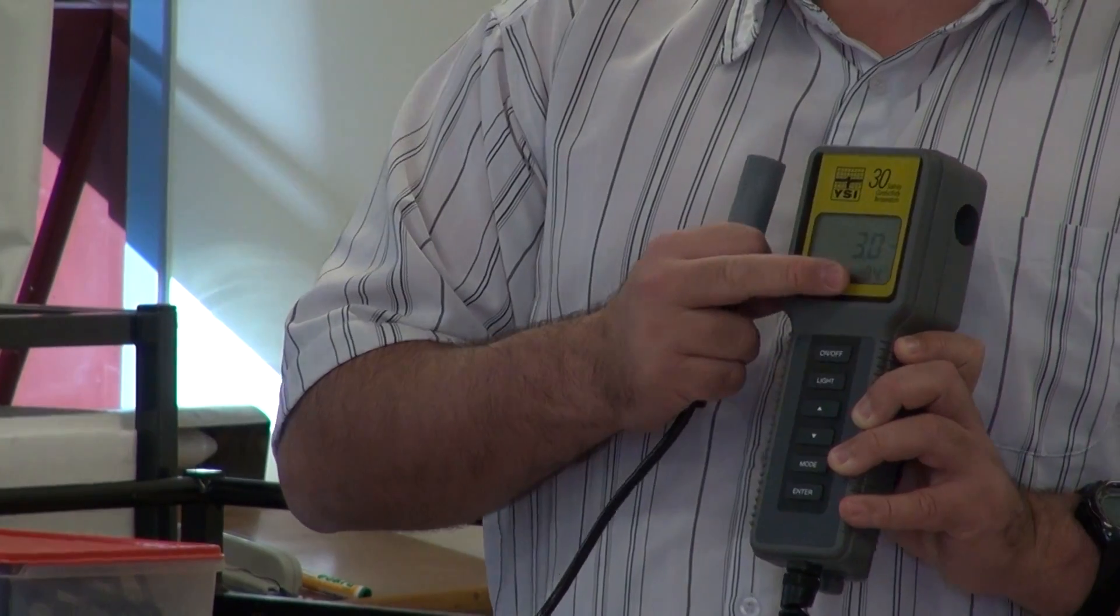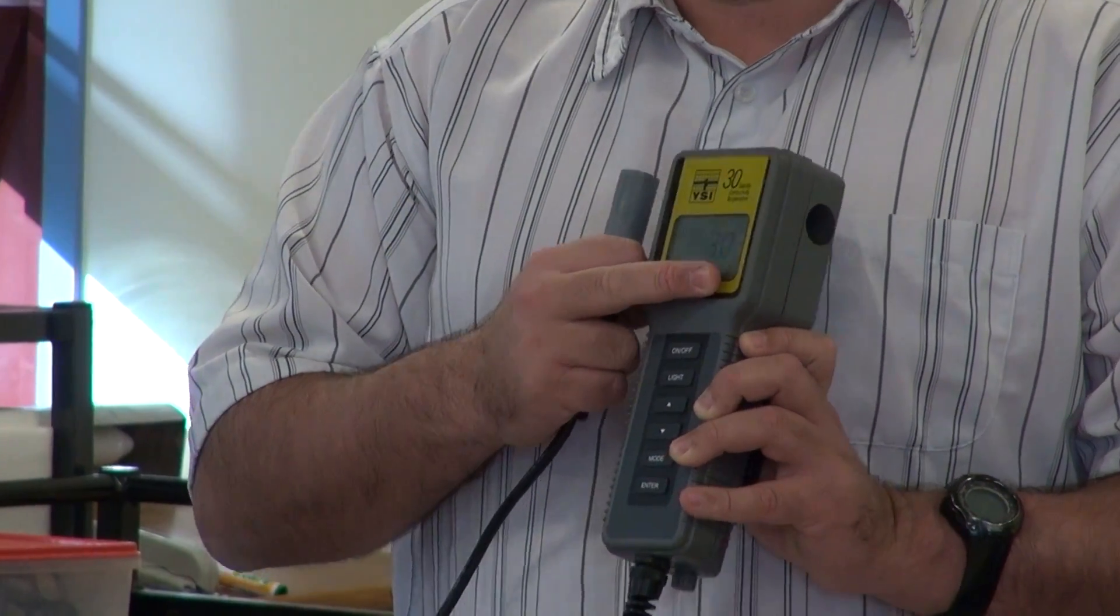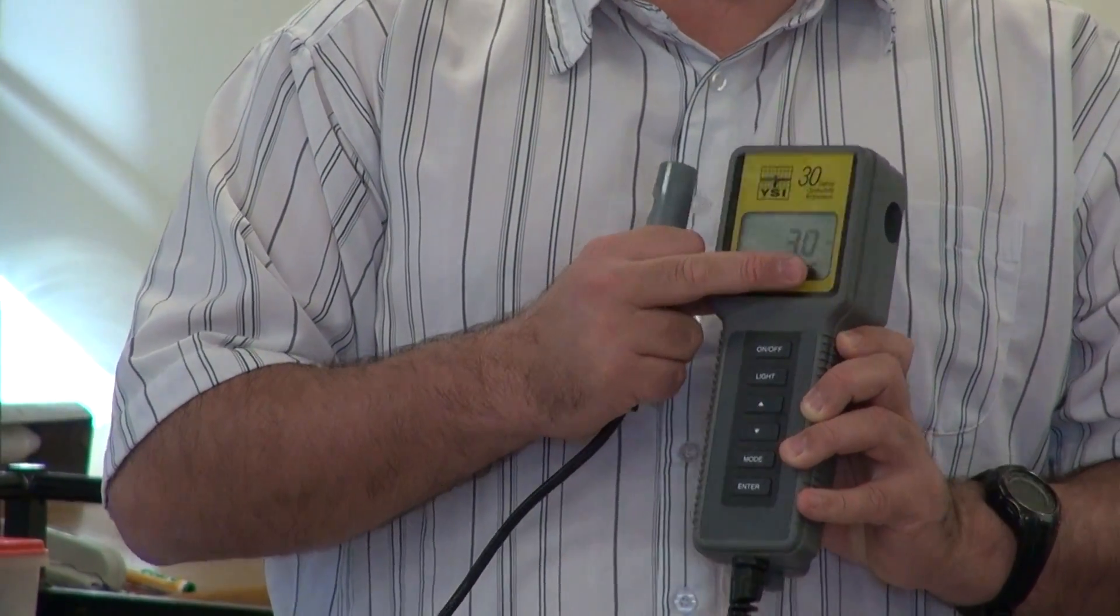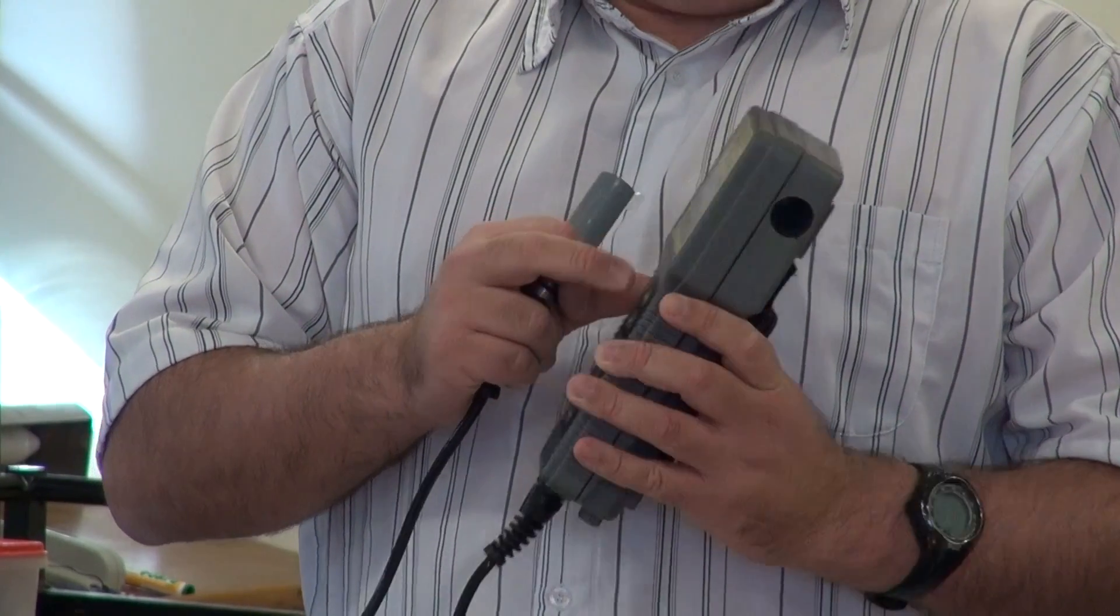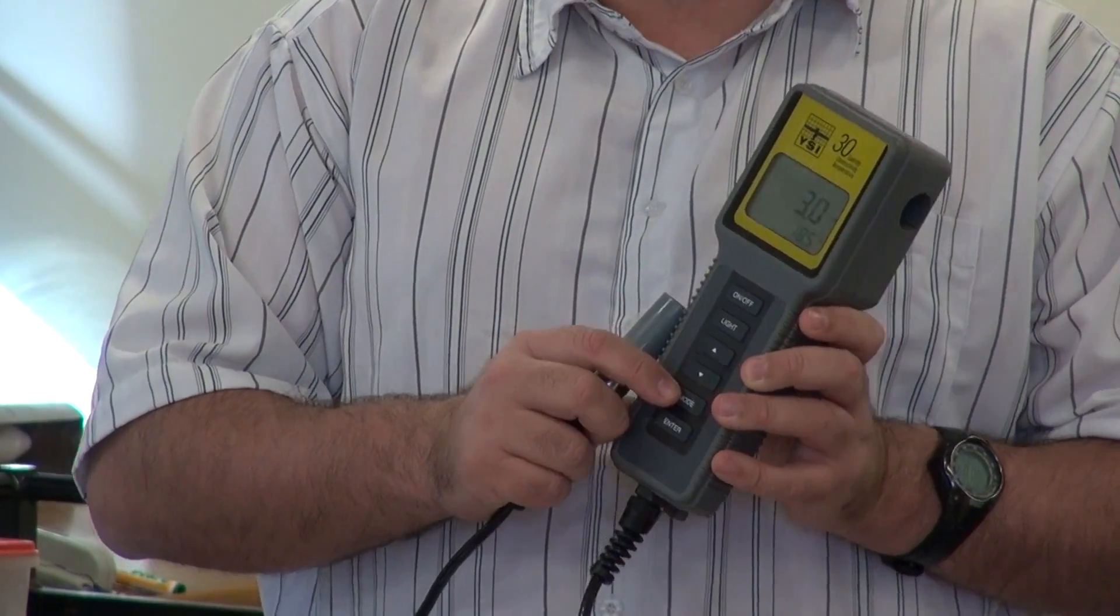Because conductivity is also related to temperature, this one is standardized to 25 degrees. So that's what the flashing one means, specific conductivity.